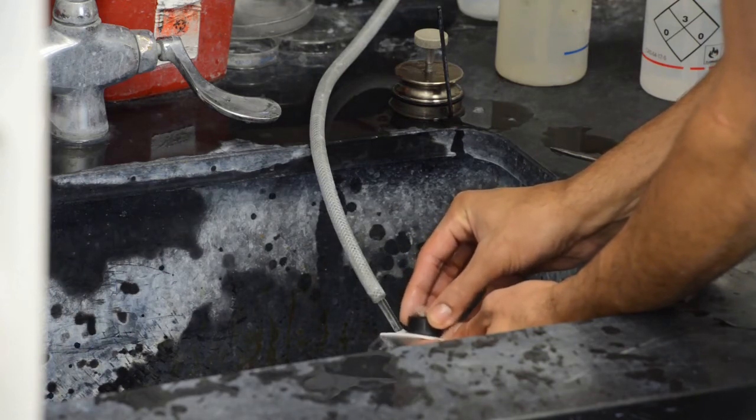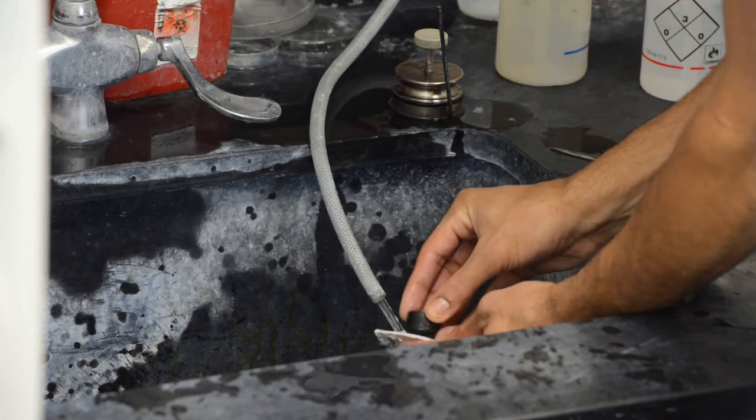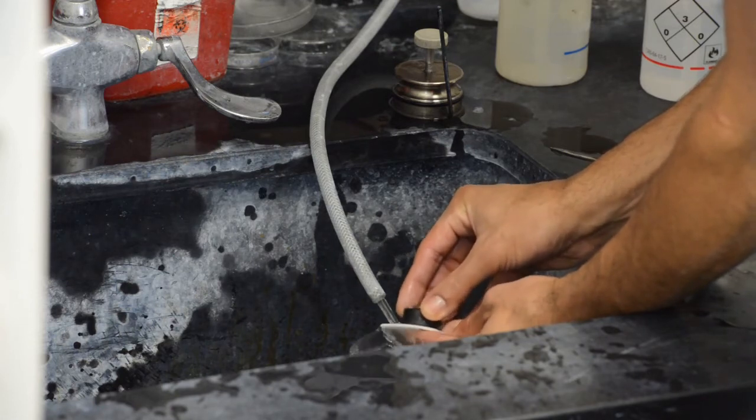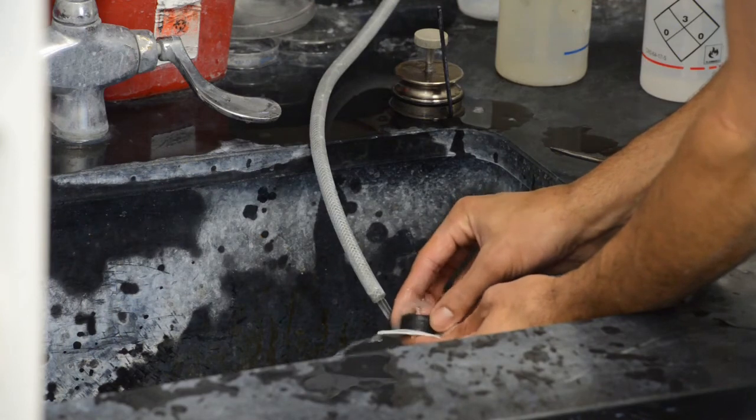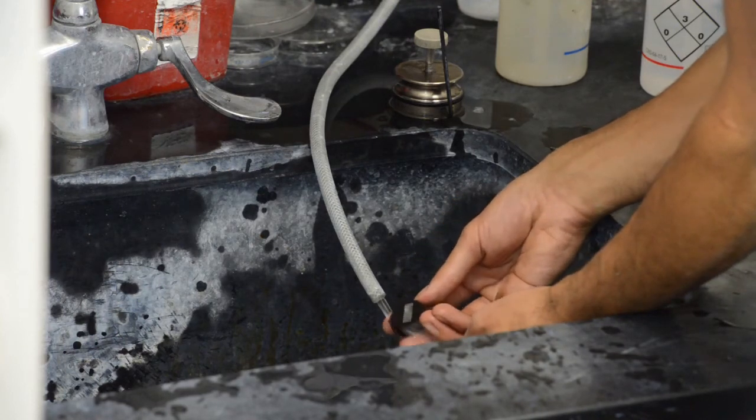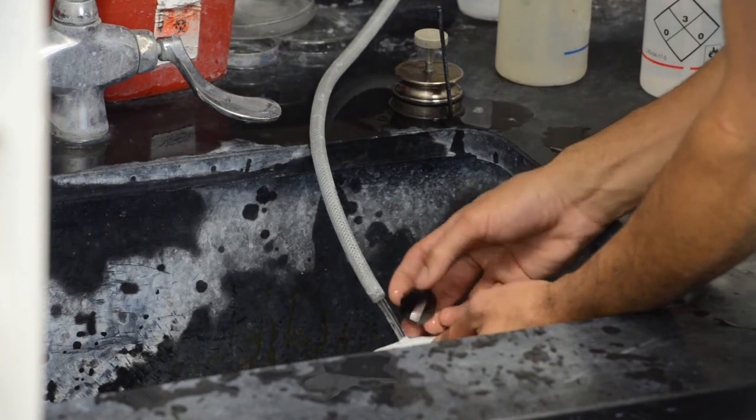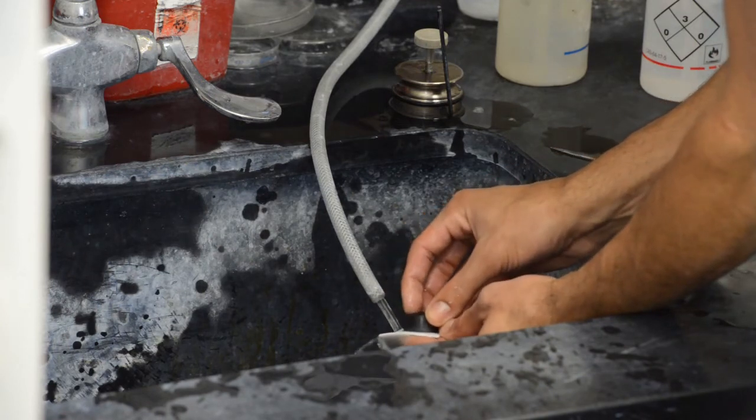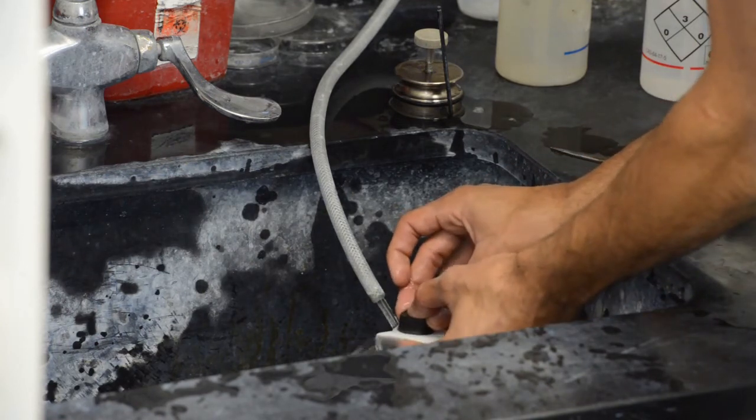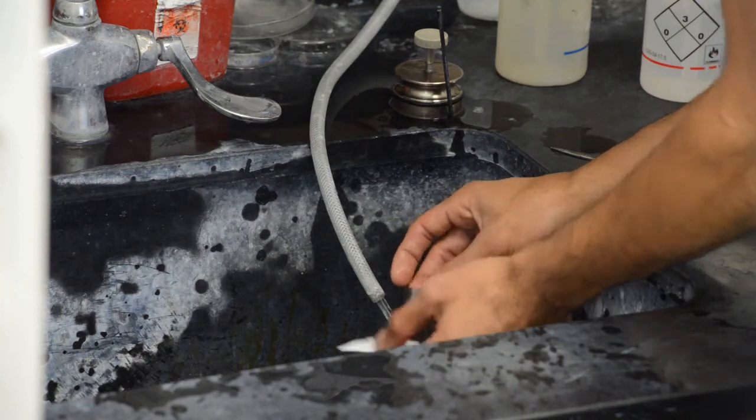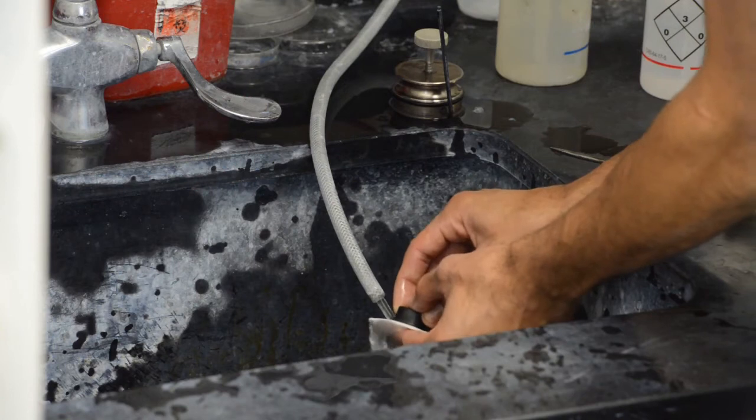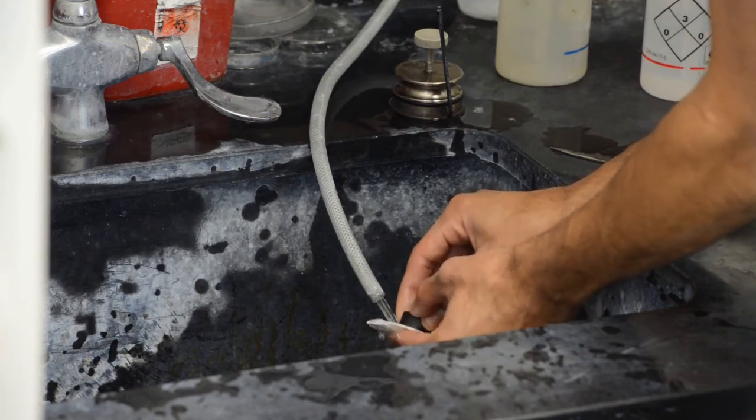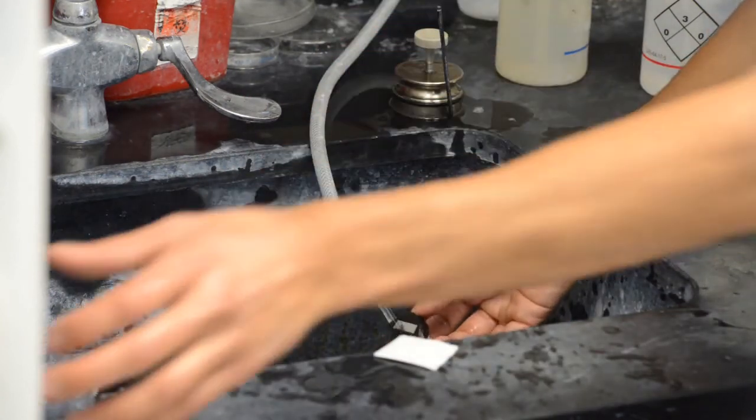And you gently rub your sample on this pad. Now think of the pad as a brush, and you want that brush to remove the particles. You want to sweep particles, whatever particles, whatever silicon dioxide particles or clogs of that solution that are on my sample. I want to brush them off. And that's essentially, that's exactly what you're doing. Grab them. Think of this as a brush. And brush the particles out with the running water. And that should give you a pretty, pretty clean sample.